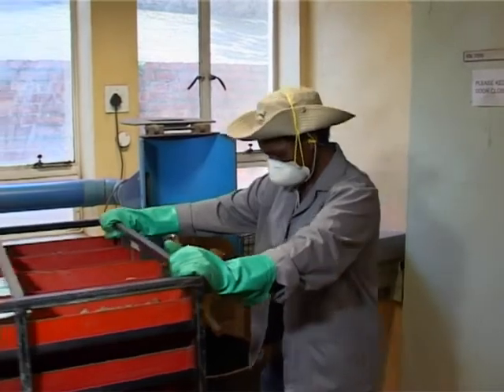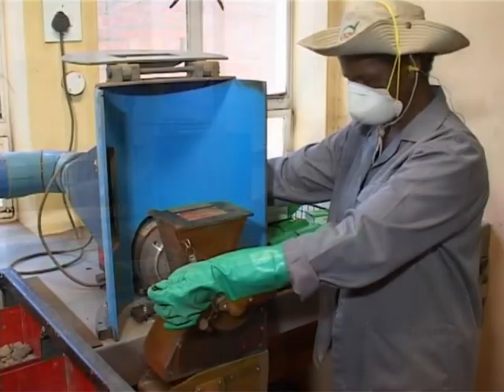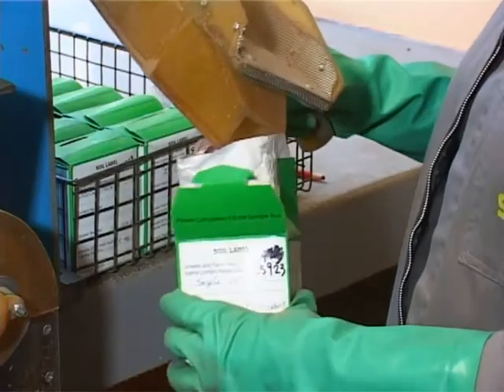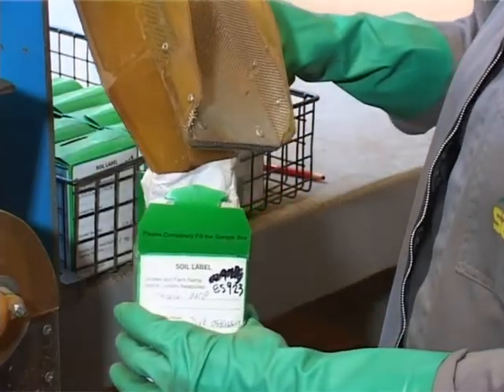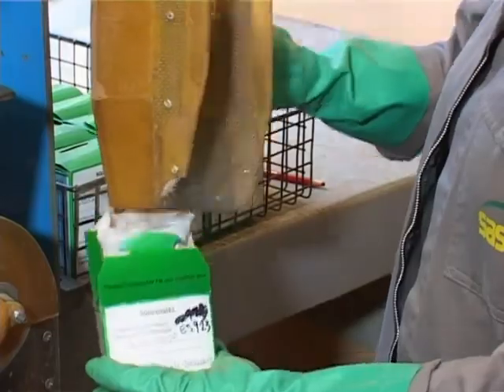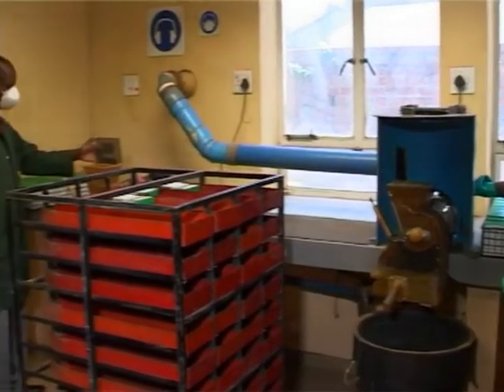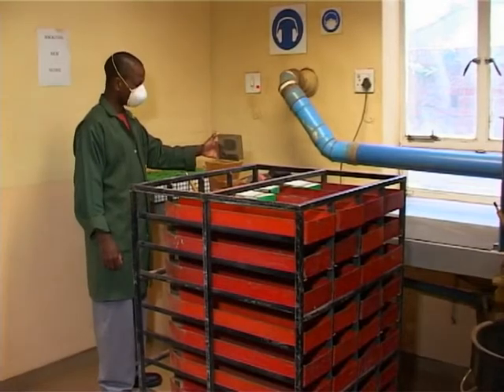Once dried, the soil samples are ground and passed through a sieve. Following this, they are returned to the soil box and sent to the preparation room in batches. We've also expanded this area to have two grinders available for soil preparation.